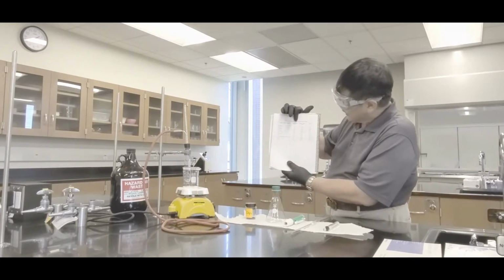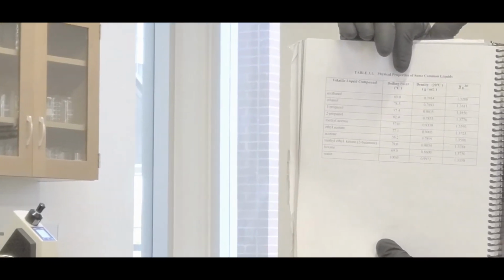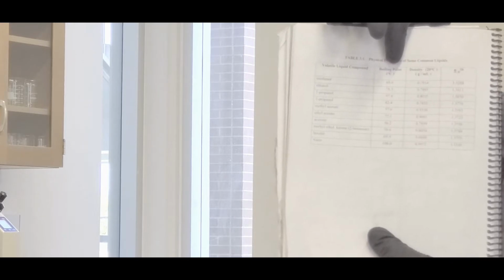The other thing is the boiling point. This is recorded for sea level. Here in Phoenix, we're about 1,100 or 1,200 feet above sea level. So there's less air above us and less pressure pushing down on the liquid, and it's easier for it to escape. Therefore you expect the boiling point of your liquid to be slightly lower than what's listed here. For example, the normal boiling point of water, at 1 atmosphere, sea level, is 100 degrees Celsius. But typically here in Phoenix, it's about 98 degrees Celsius because we're at a higher elevation. So you expect your boiling point to be lower.